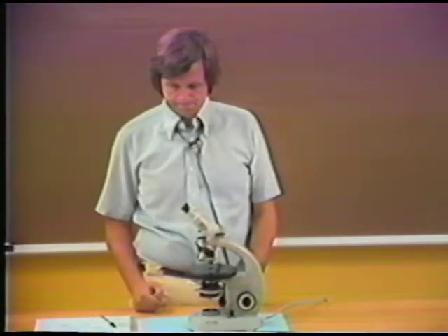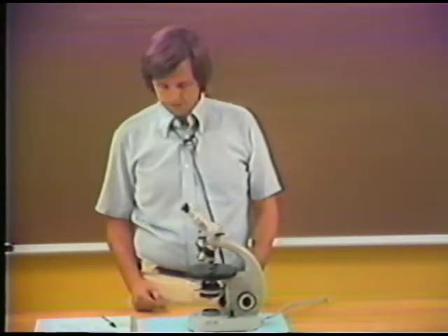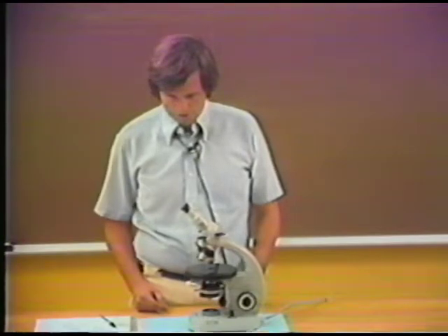In this tape segment we're going to describe the optical properties of anisotropic minerals using orthoscopic view. And we're going to show how to use these properties for identification of specific minerals. So I want to run through a list of optical properties that you can measure in orthoscopic view.